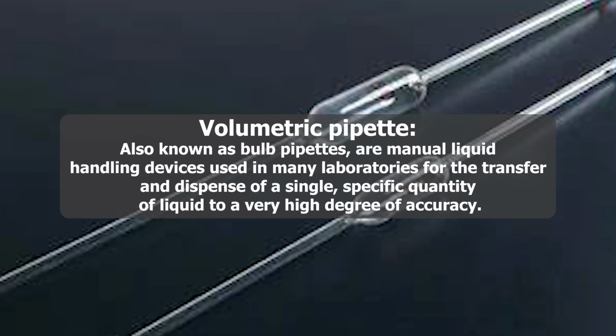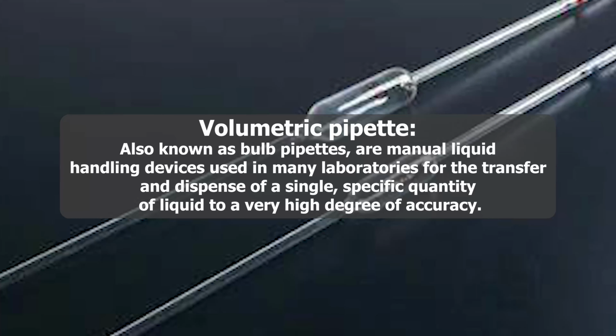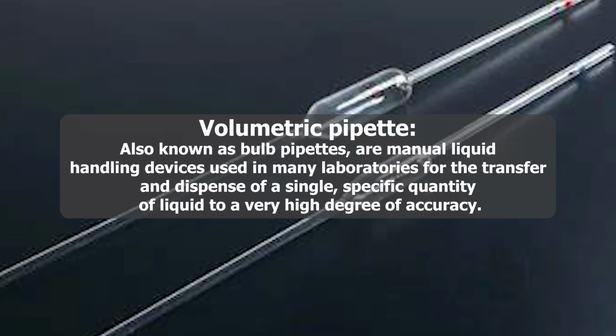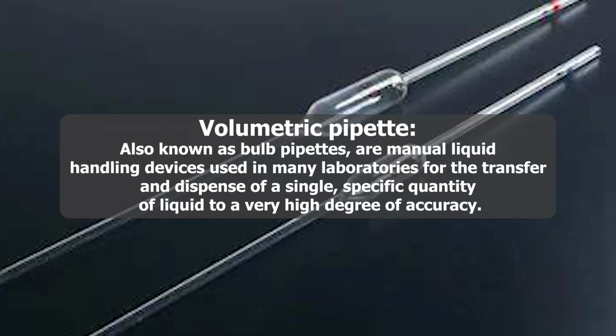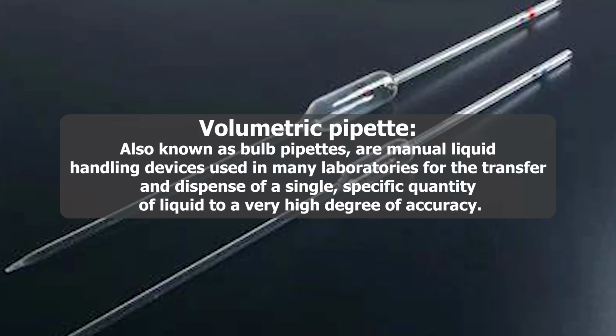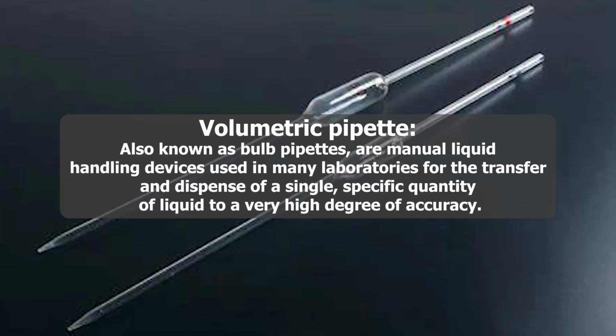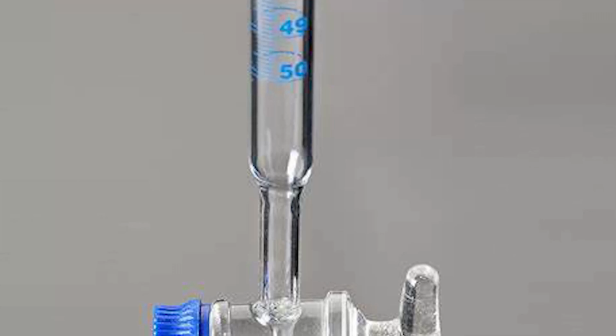Volumetric pipettes, also known as bulb pipettes, are manual liquid handling devices used in many laboratories for the transfer and dispense of a single, specific quantity of liquid to a very high degree of accuracy.